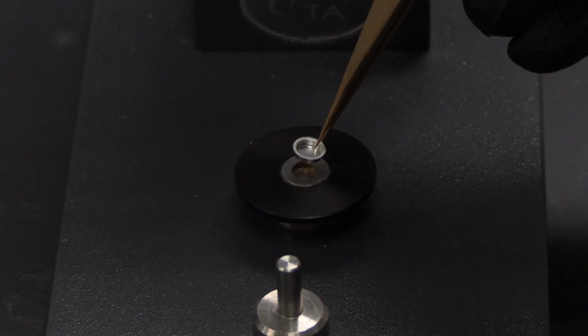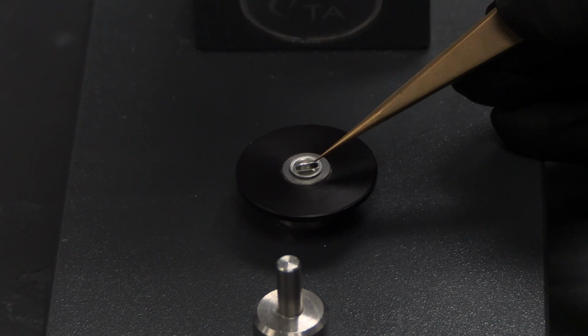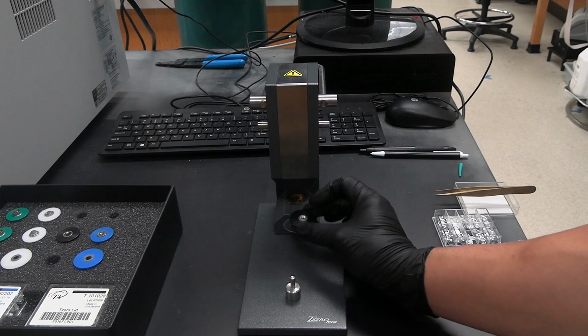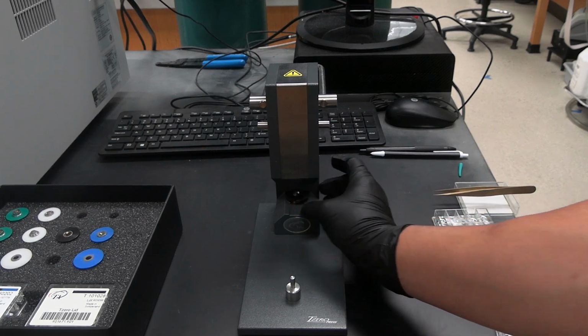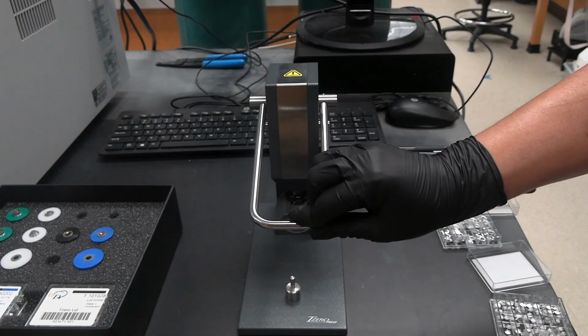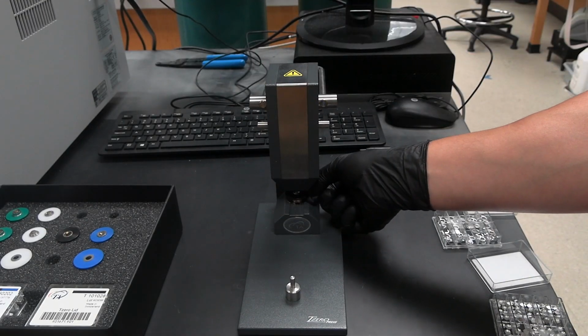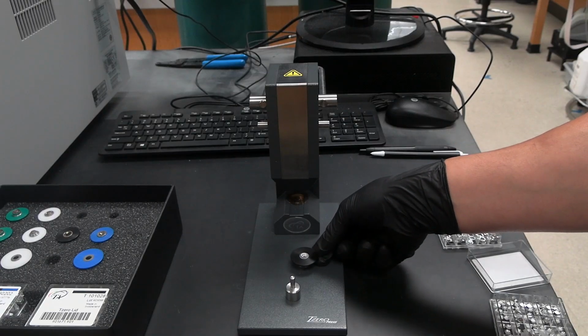Place the sample pan in the concave die half, then place the pan lid on the sample pan. Place the concave die half in the lower portion of the press. Push the press handle all the way back and then pull the press handle until the handle makes contact with the front pegs. Remove the compressed sample pan from the press.